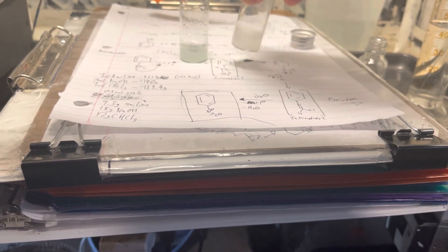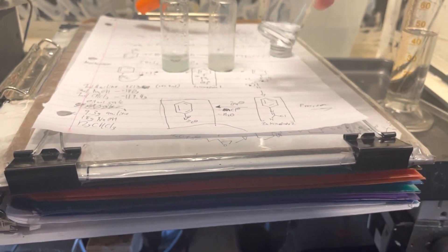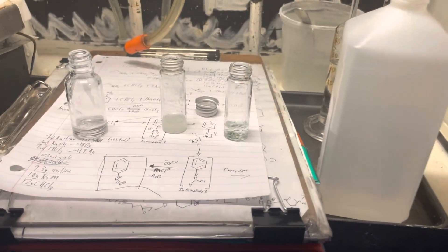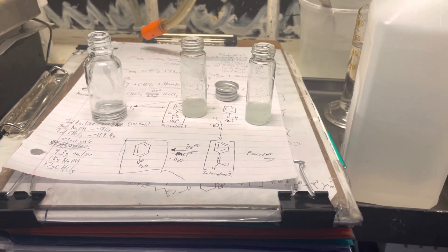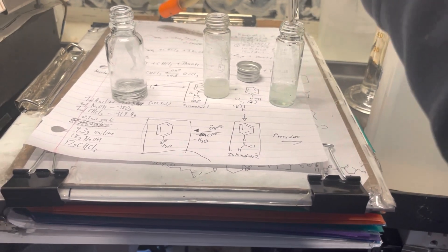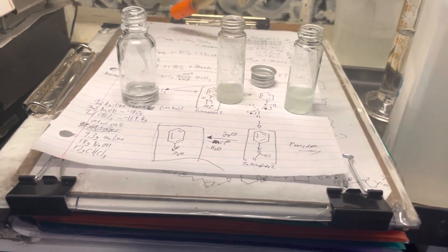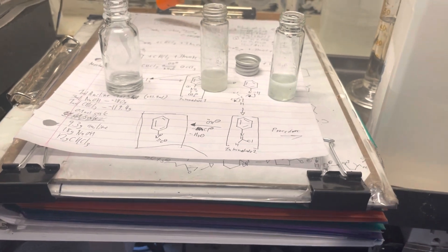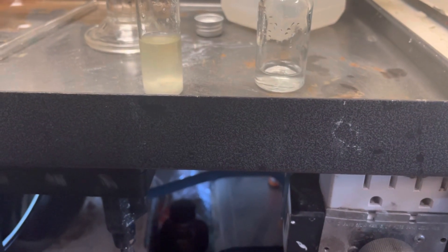It's really simple. Apparently LabCoats is gonna make a video on isonitriles as well. I'm not gonna pursue it any further because it smells horrible. Here's me adding a bit more ethanol to each of the solutions because they didn't dissolve properly — not enough ethanol. This did not seem to harm anything; it's just a solvent. Shouldn't be too worried about it.